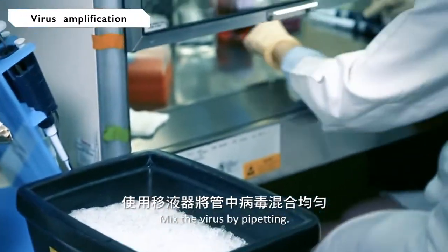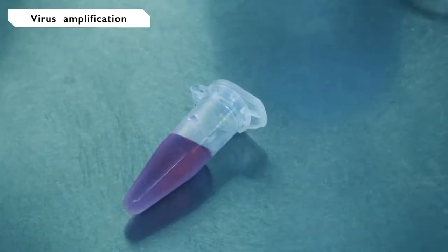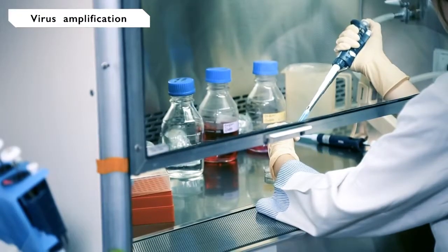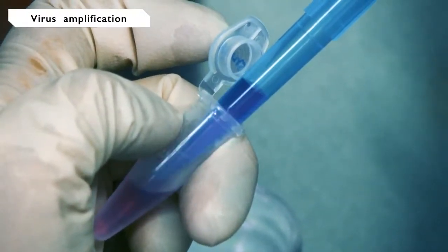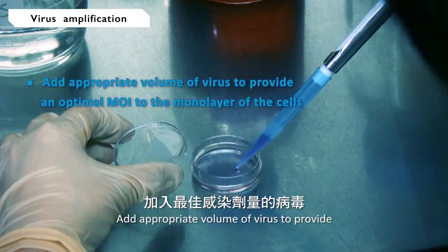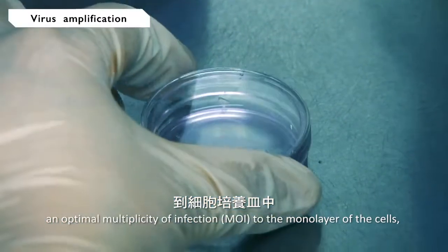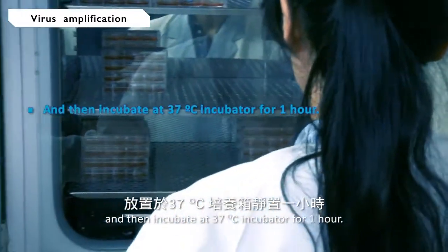Mix the virus by pipetting. Add an appropriate volume of virus to provide an optimal multiplicity of infection, short for MOI, to the monolayer of cells, and then incubate in the 37 degrees Celsius incubator for an hour.